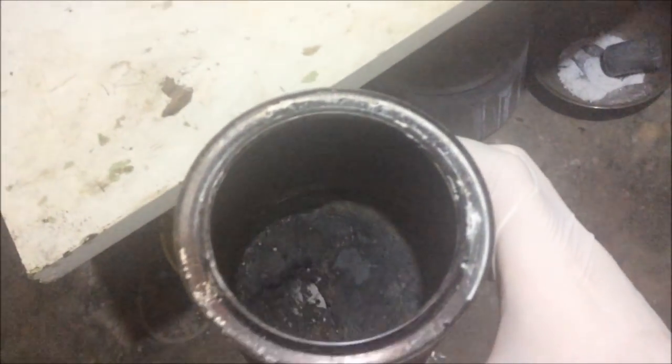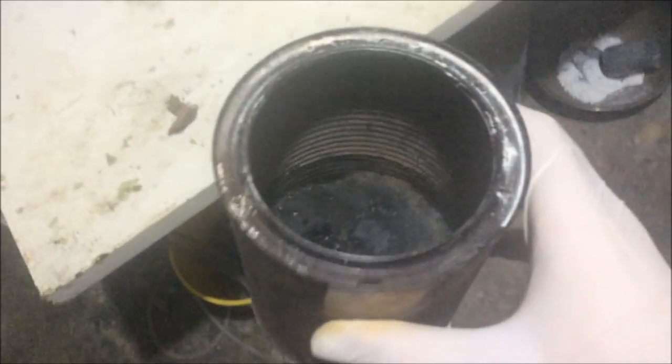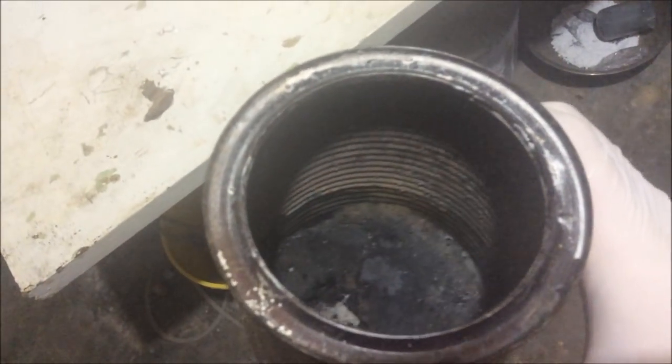I thought maybe I just sort of tortured it as hard as I could. No, I didn't do it as hard as I could. I did do it as hard as I could by the end of it, just to see if I could dry any more off. But yeah, it's a shame that all of it's sort of just charred up, as opposed to coming over nicely. I'll see if I can knock this out and see if it's all black. So yes, it is charred basically all the way through.